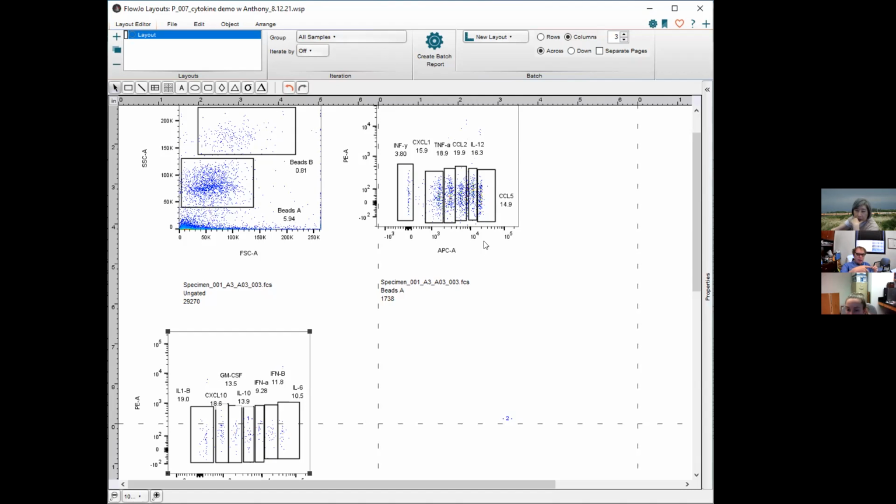So the secondary antibody is hanging out there, and it's going to bind streptavidin, I guess, right? Yeah, it completes the sandwich. It's a sandwich ELISA, and it's labeled PE on this bead. Each one of the dots represents a bead. So some beads are very strong PE, and some are low.